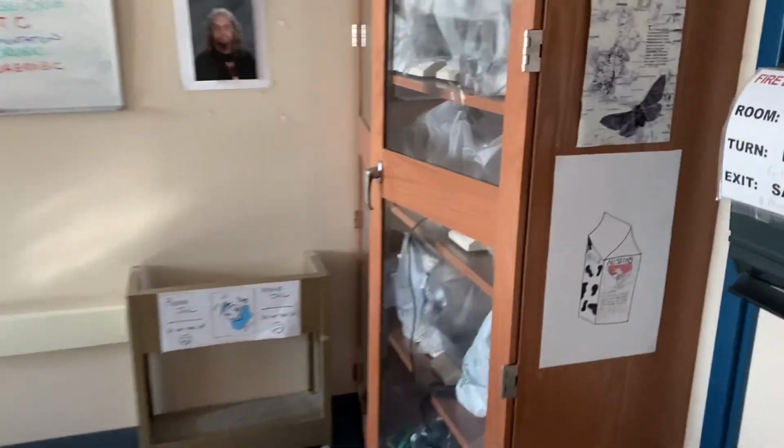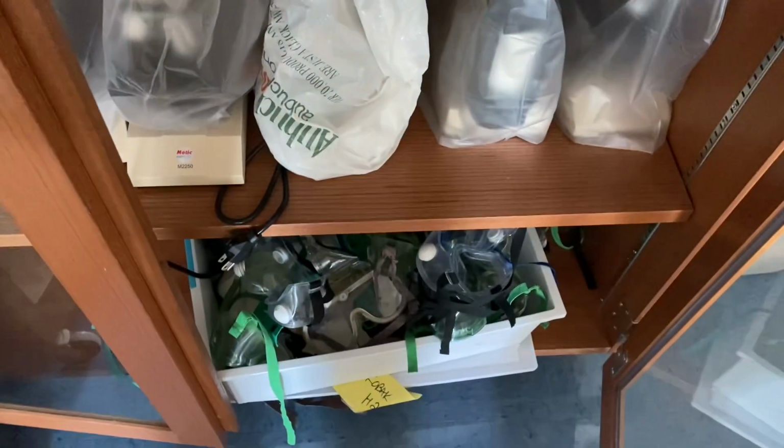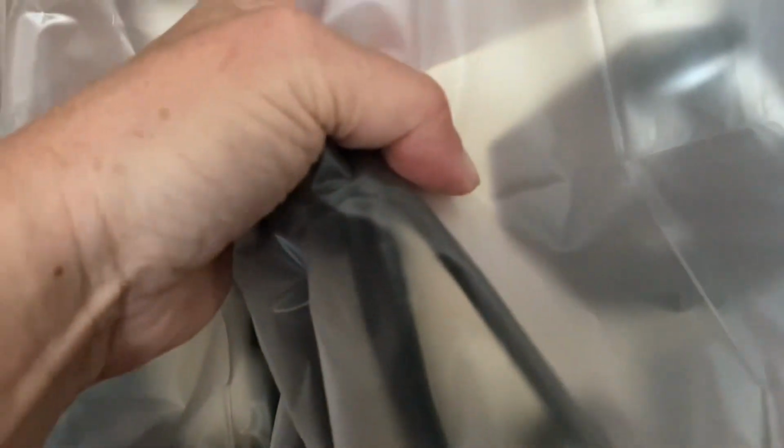All right, so my microscopes live here in the microscope cabinet. You may remember this cabinet from dissection trays and goggles. Well, you won't need any of those. You'll need a microscope. When you grab the microscope, grab it by the arm, and then put one hand on the base. You bring it to your desk, and you put it flat on your desk. And you notice the microscope is covered.